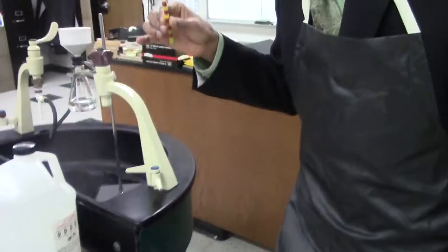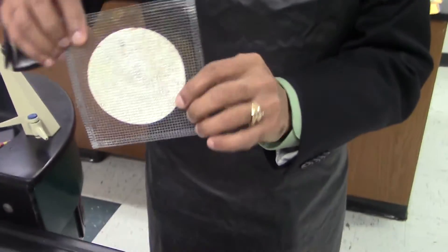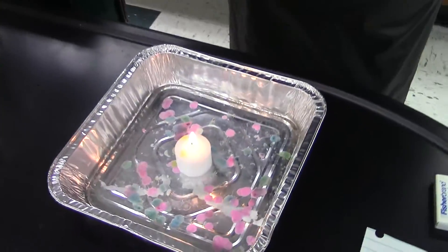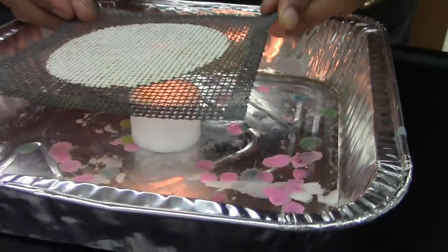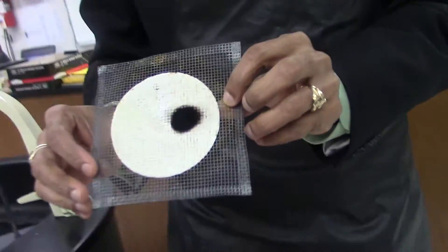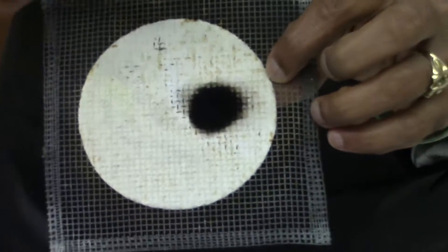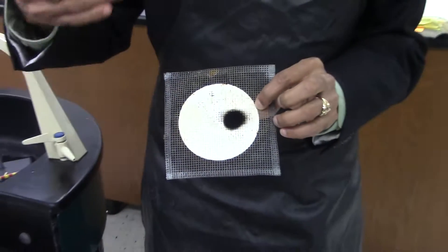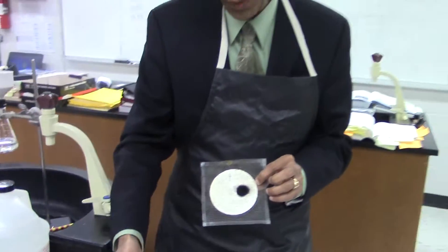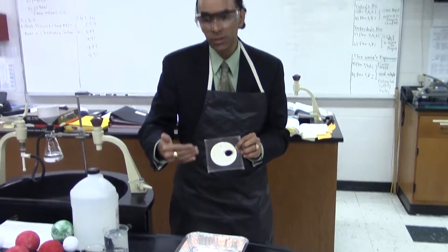I'll put that away. I have a wire gauze. If you look on both sides, you don't see too much on it. It's a white wire gauze with a ceramic piece in the middle. If I were to bring this gauze all the way down on the flame — all the way down for a little bit without touching the candle — and pick it up after a little bit, look what has happened. Something dramatic has happened. This proves that in the whole combustion process, carbon black is produced. The symbol of carbon is C, and this is one form of carbon. There's graphite, there's diamond, there's buckminsterfullerene, and the fullerenes in general. Here's a clear proof of producing something that was not there before — we had the wick, we had the candle, and now we have a black substance being produced. This is evidence of a chemical change occurring in this simple chemical reaction.